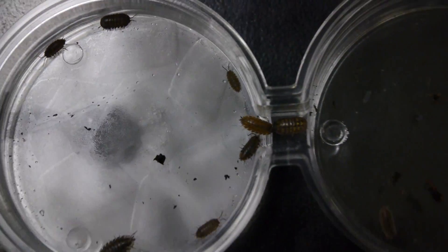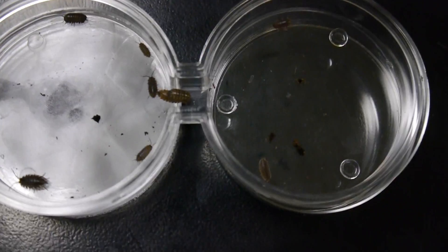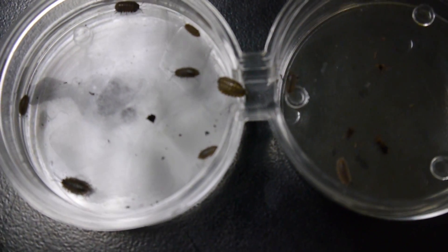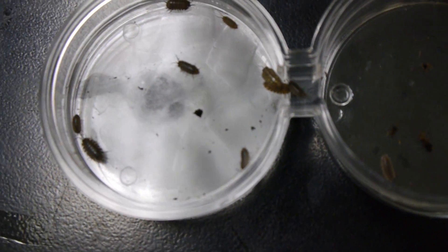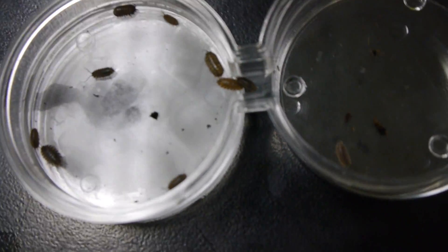Time's up. And to analyze — they're all basically over. That one just ran back over. They're all on the cold side except one.